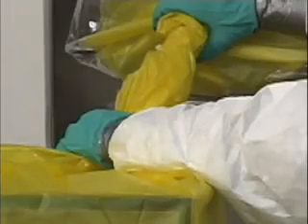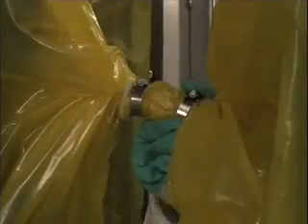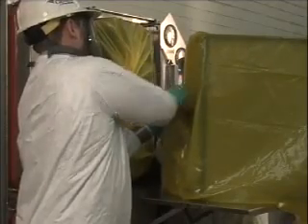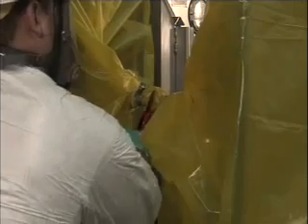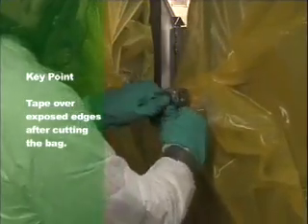Using the materials from the banding kit, tie strap approximately 8 inches of the twisted bag to secure. Place 2 metal straps around the change-out bag, in between the tie straps, and tighten to hold twisted part of the change-out bag securely. Cut completely through the change-out bag in the middle of this section, leaving a stub bag on the bagging ring of the housing. Tape over the exposed edges where the bag was cut. Remove the contaminated filter in the bag for disposal.